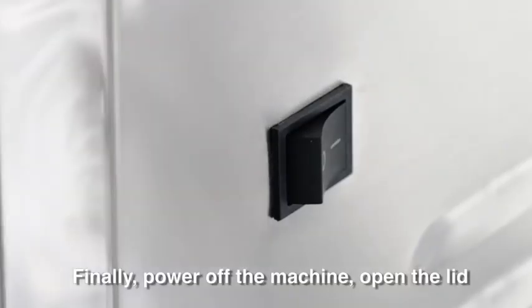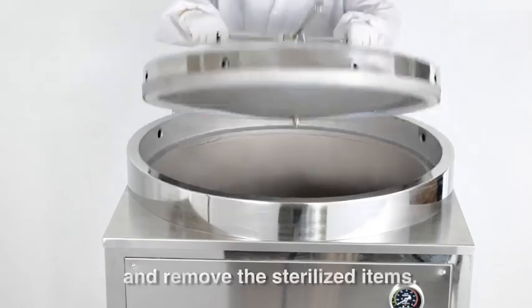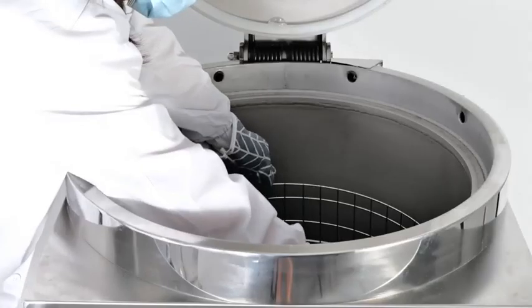Finally, power off the machine. Open the lid and remove the sterilized items.